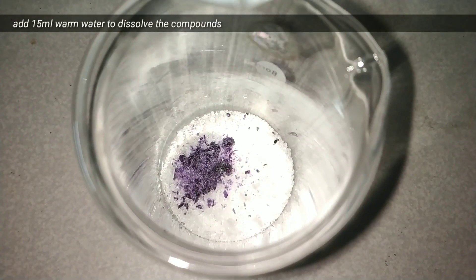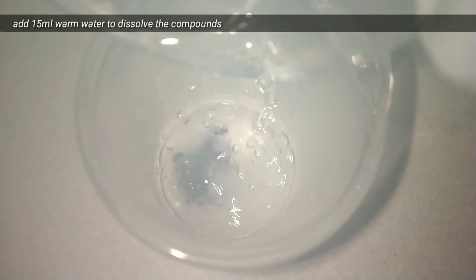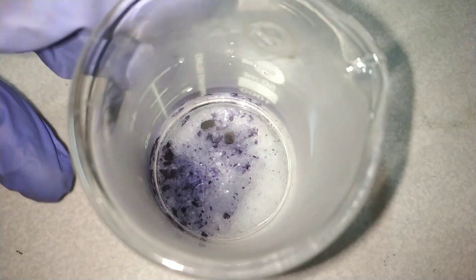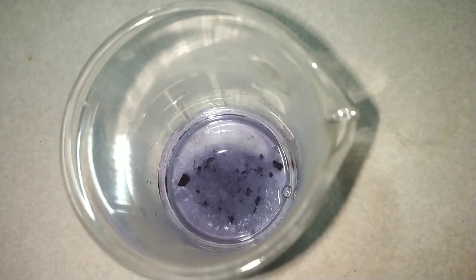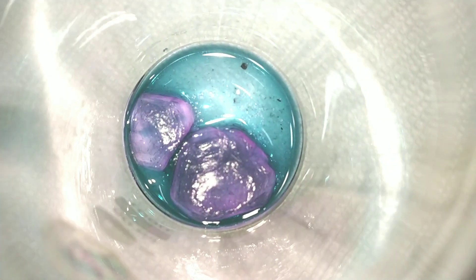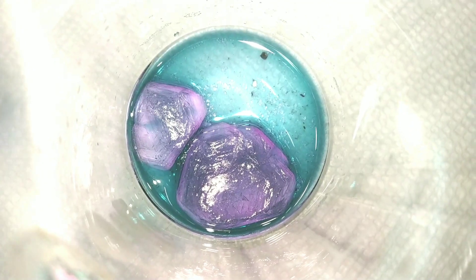I added 15 ml of warm water into the beaker in order to dissolve both alums. After dissolving completely, I allowed the solution to stay undisturbed for 2 weeks. And after 2 weeks, you can see a beautiful crystal has formed.